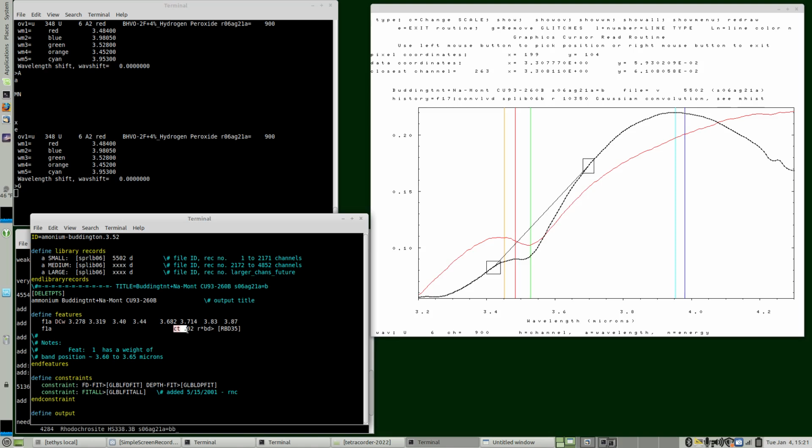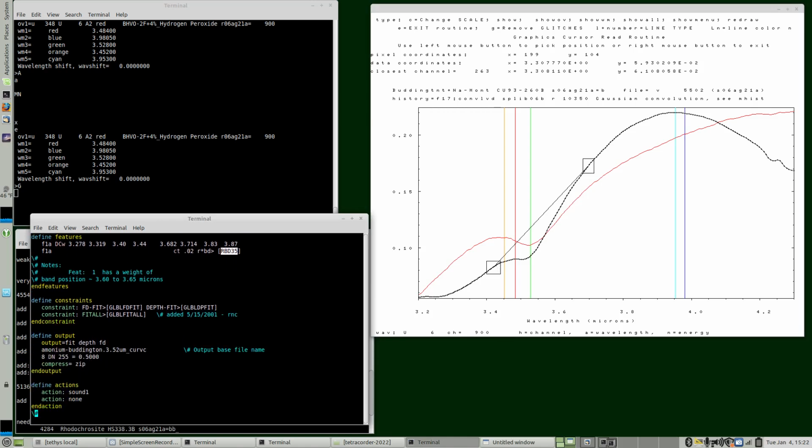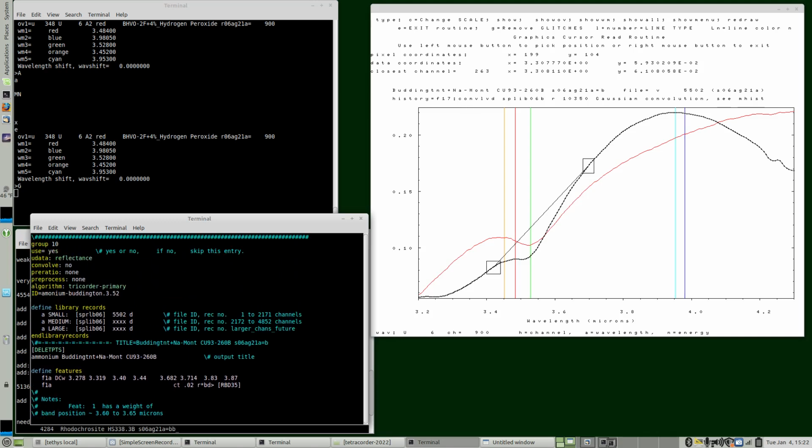These kind of things are pretty generic, unless the sample is extremely dark, so continuum threshold of 0.02, 2% reflectance, and we see out here we have 15% reflectance for this spectrum, so that's quite reasonable. We'd have to look up what this is: the reflectance times the band depth has to be greater than what this is, and we don't have that here. We'd have to go and look it up in the original expert system, but that value's been working, so we'll keep it for this feature also. So with that, we're done, and now we can drop that into the expert system.